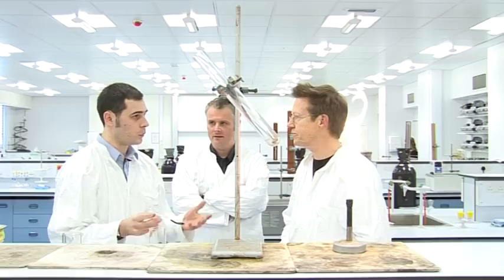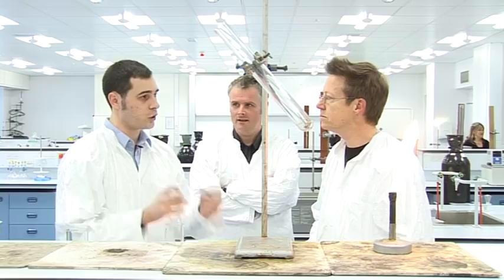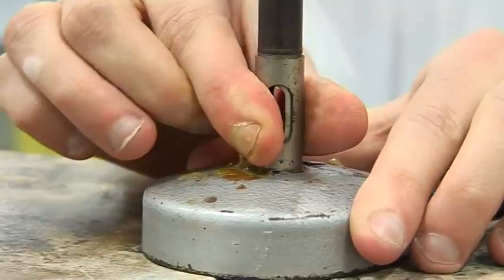So what are you going to do first for us Jonathan? We're going to take an oxidant, which basically is a source of oxygen. We're going to melt it so it's incredibly reactive and it will instantly react with anything we give it, and then we're going to give it a source of sugar which will mix with it and burn and combust to form carbon dioxide and water, but very very quickly. Obviously don't try this either, this is a science lab.